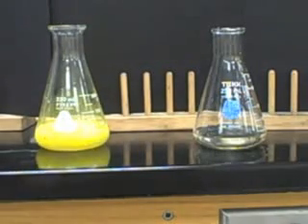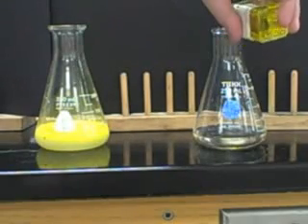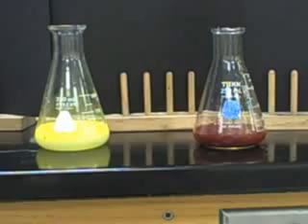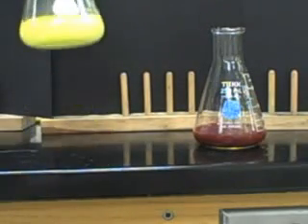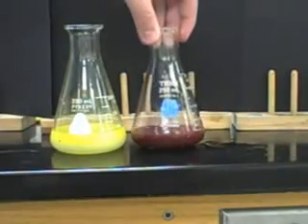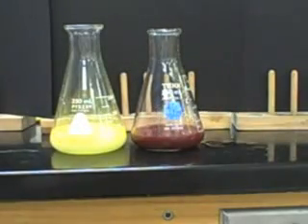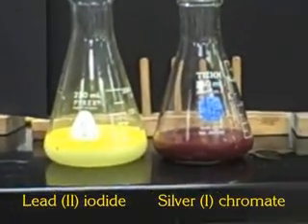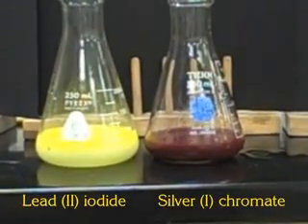That's amazing. And then we're going to add our yellow potassium chromate to our silver nitrate for a blood red precipitate there. That's also amazing. So you can see here is lead 2 iodide and silver 1 chromate. You can see those are both amazing reactions there, iodide and the chromate.